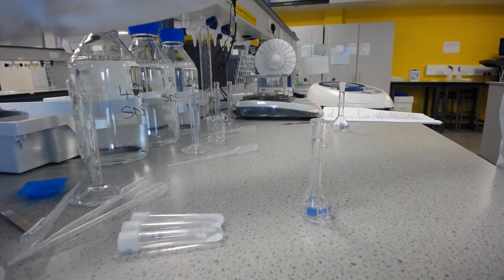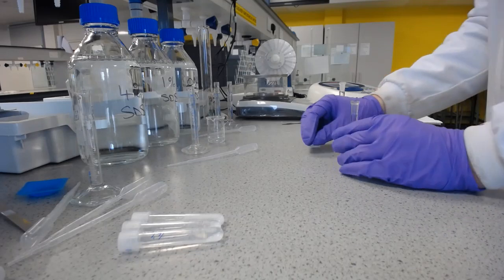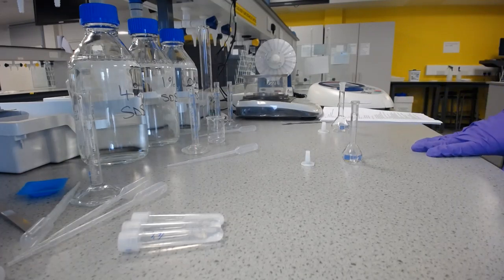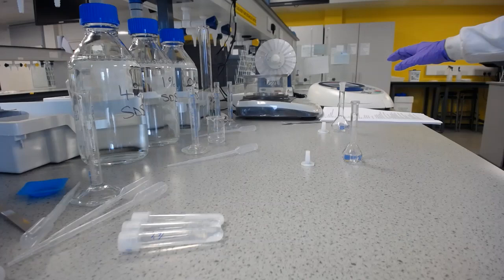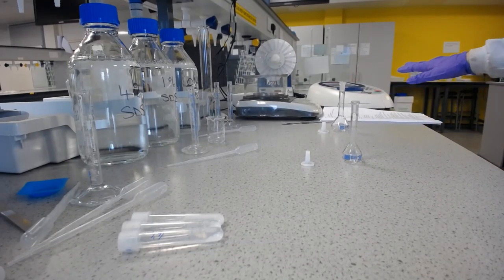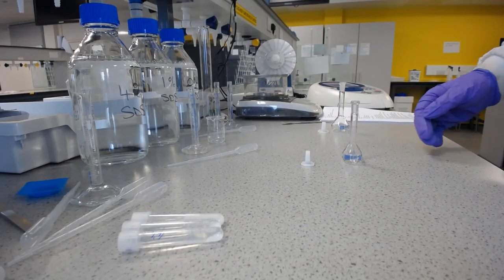So we can then put that to one side, and we need to do the dilutions to get this into the ballpark area of where we're going to actually be able to take a reading. Remember how much you've diluted it and by the factors by which you've diluted it, because once you've worked out the concentration from here, you then need to multiply whatever the answer is to get the original concentration. So we're going to be working out the concentration of the diluted sample, and then we need to just use the same factors to go back to what the original sample was.